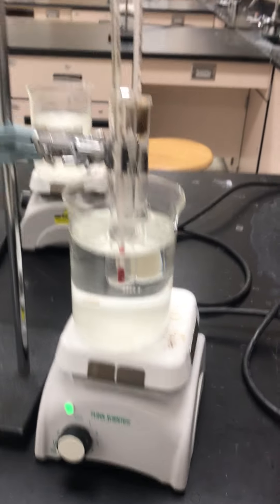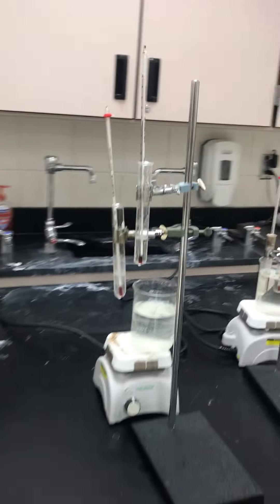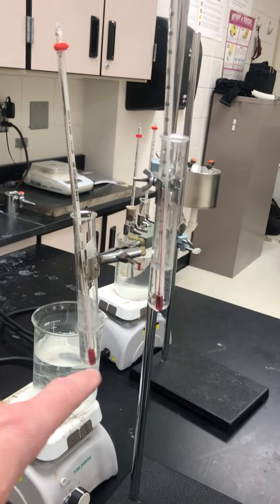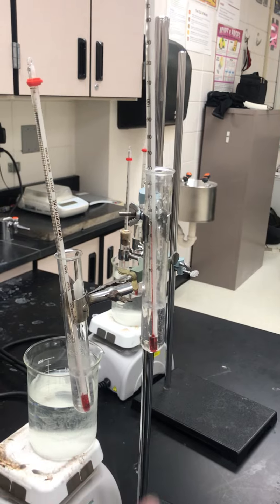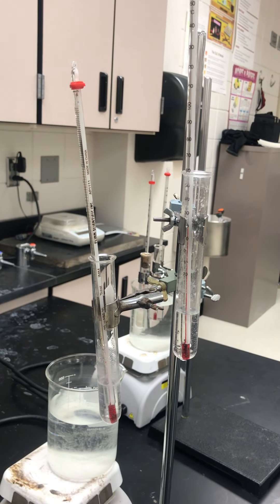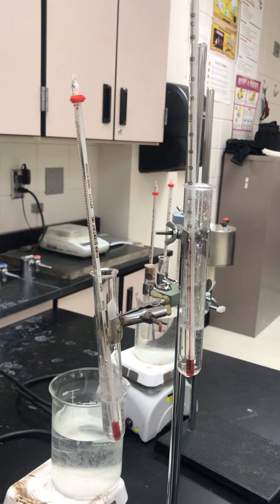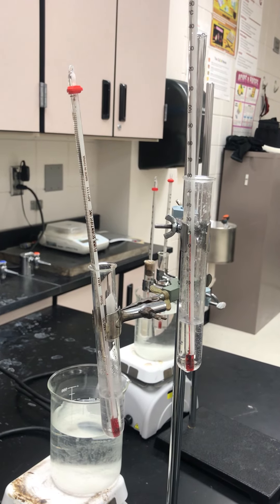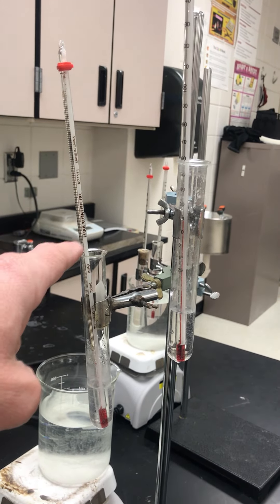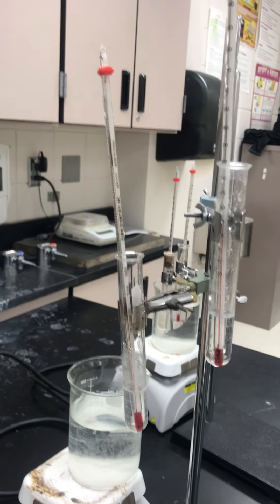And then what's going to happen is it's going to look like this. So we have one test tube of water, the other test tube is stearic acid. They look almost exactly the same when they're liquid like that. And then what you're going to do is take time and temperature every 30 seconds of the water and of the stearic acid.